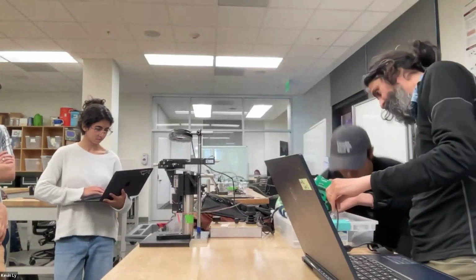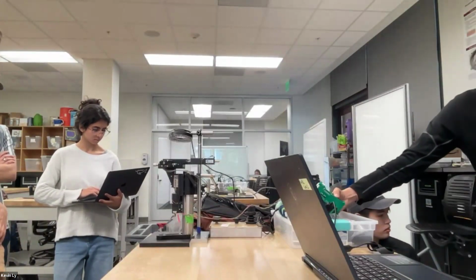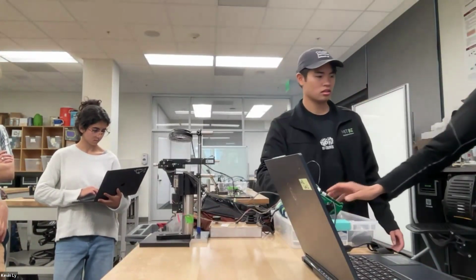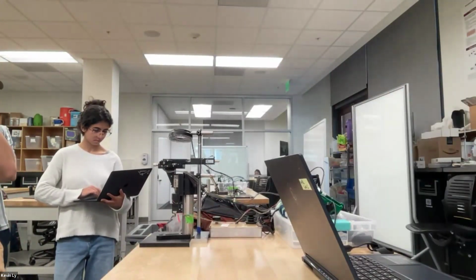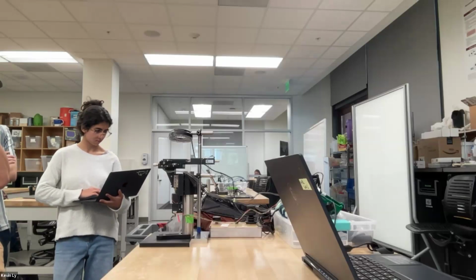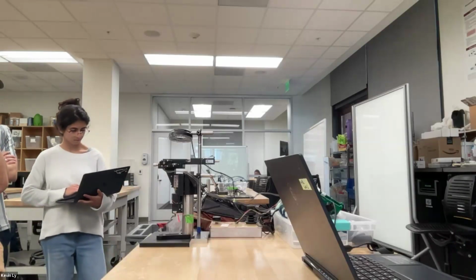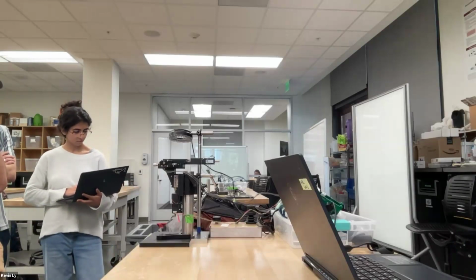The power? Yeah. See how far you need to go. Is there no other power here? Yeah, let's bring this one up. Funny, and it's supposedly a lab base. Oh yeah, unplug that, and then we will have a power cord.